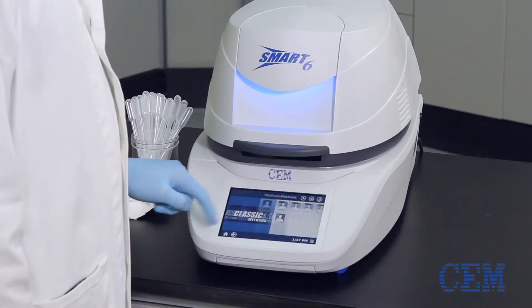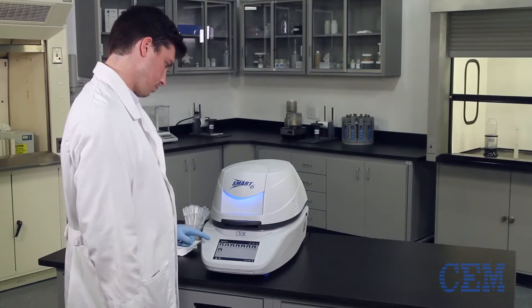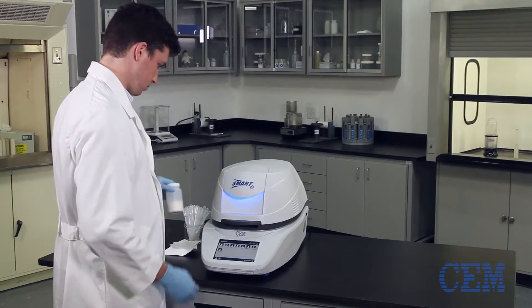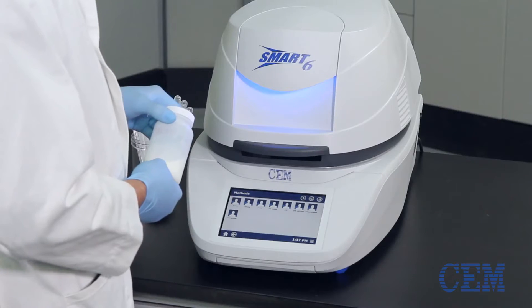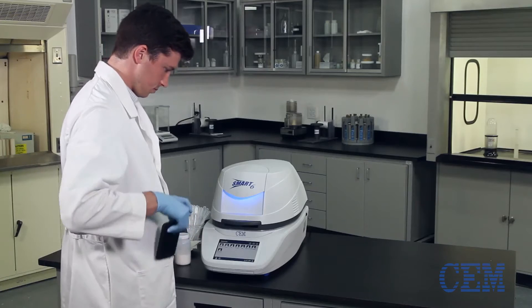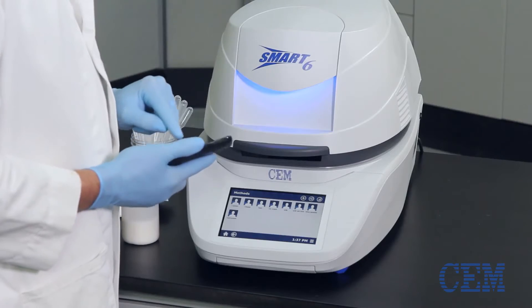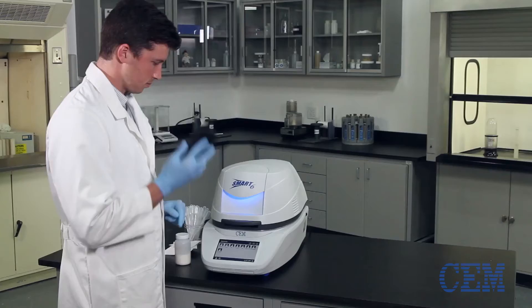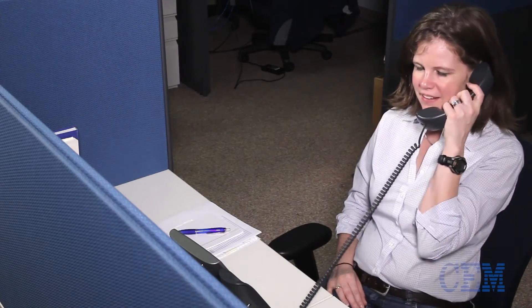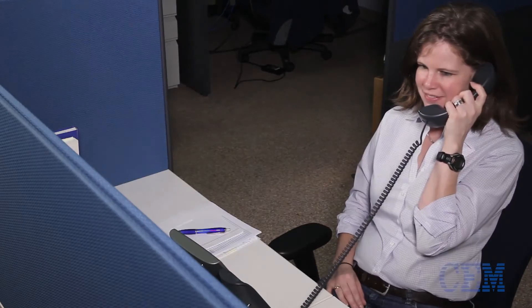Next, choose the method that corresponds with the sample you're ready to test. If you'll be testing a new sample for the first time, please consult your local CEM representative or application specialist who can guide you to our library of methods or assist you in the development of a new method.